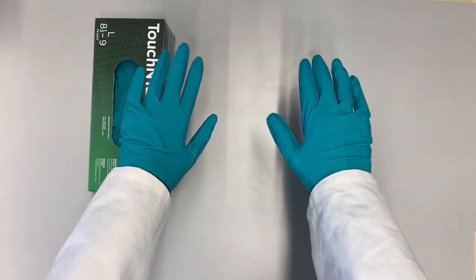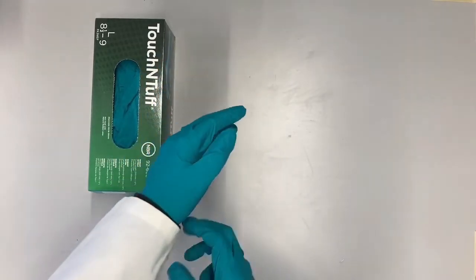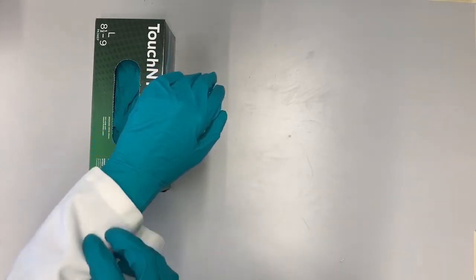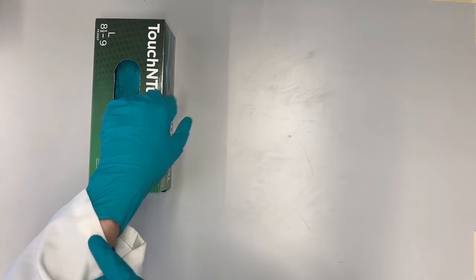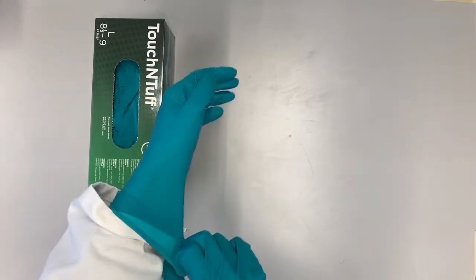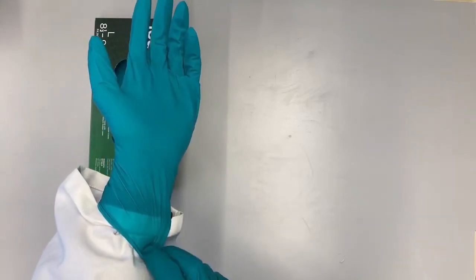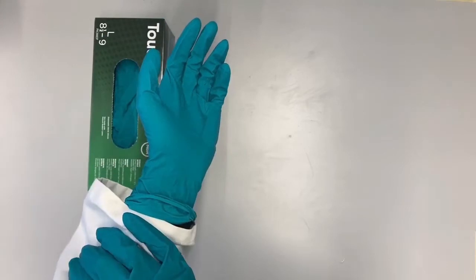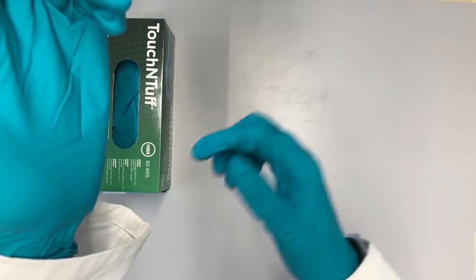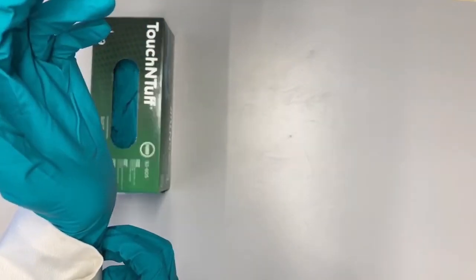As you can see now, my lab coat is over my gloves and my hand is fully protected. If your lab coat is not as long, always make sure that there is no bare skin between the gloves and your lab coat. If you really want, you can even put the glove over your lab coat, because the lab coat tends to have a big gaping hole near your hand where liquids can go in, so you can protect that by covering it with your glove.